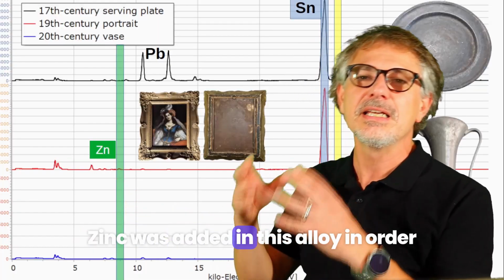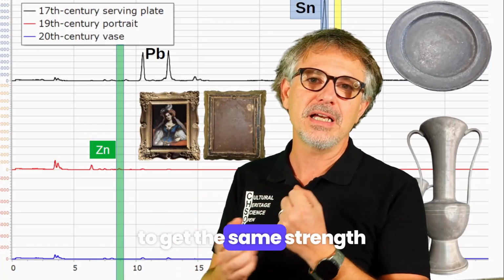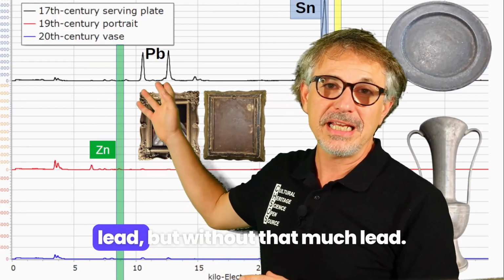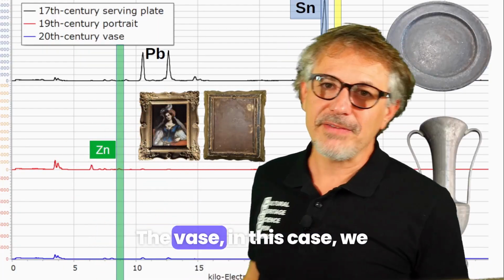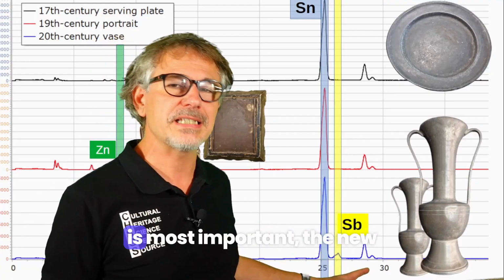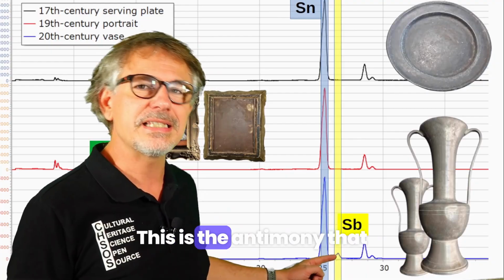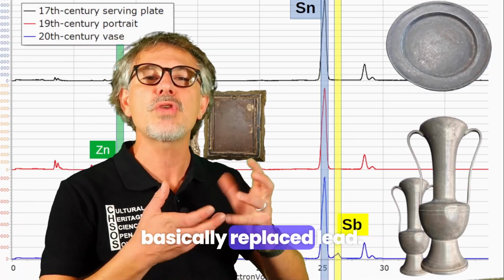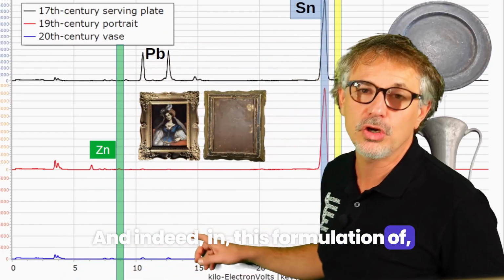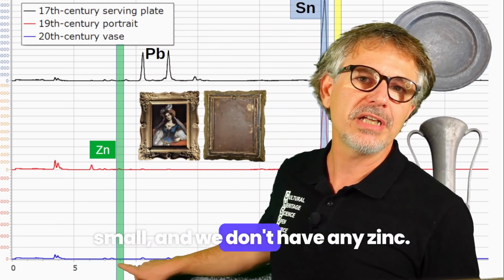Zinc was added in this alloy in order to get the same strength as we had before when there was lead, but without that much lead. The vase, in this case we see the tin, but we see, and this is most important, the new addition, this peak over here. This is the antimony that basically replaced lead. And indeed, in this formulation of this vase, you see lead is very small, and we don't have any zinc.